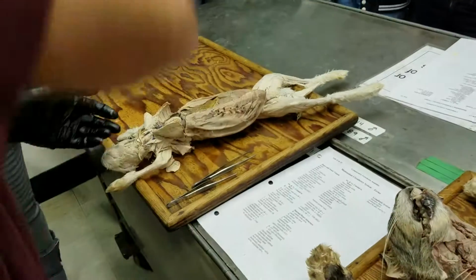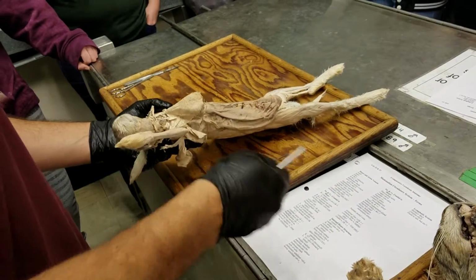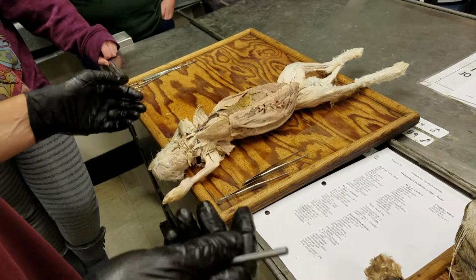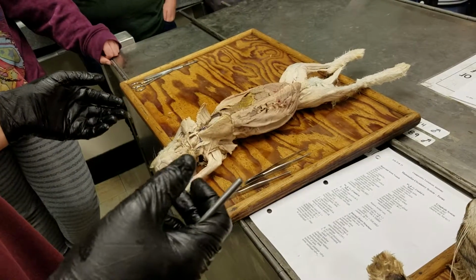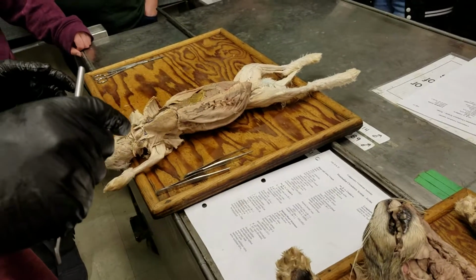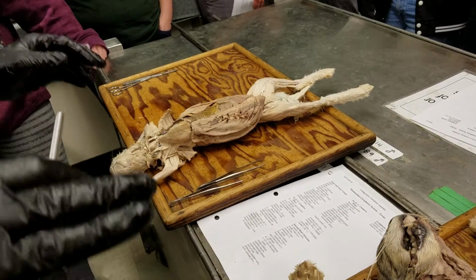Is it a human heart? That is a sheep heart. We have human hearts. The human hearts are actually about half again as big as that. They're quite a bit larger, and I'll probably pull the human hearts out next time when we're doing the internal heart structures to look at. Although sometimes it kind of creeps people out, but they're cool.